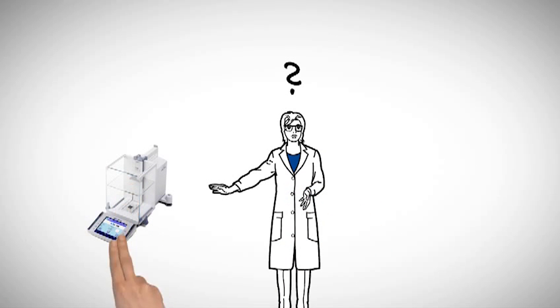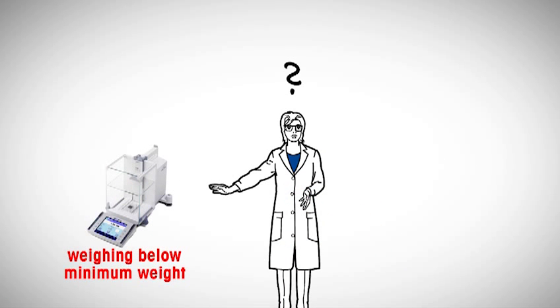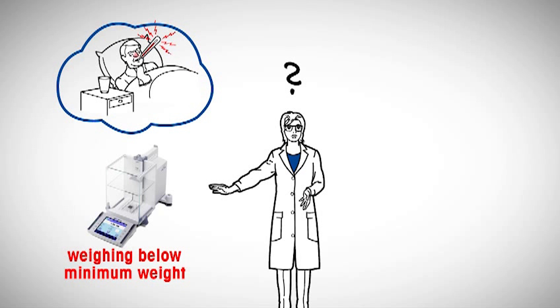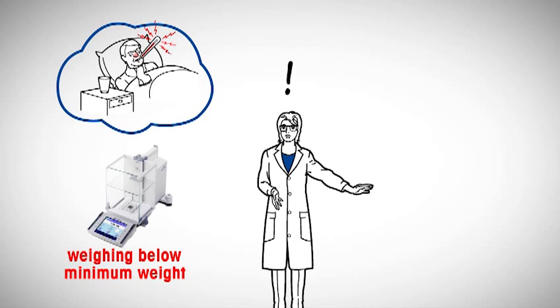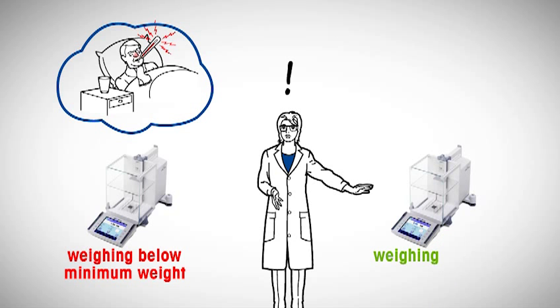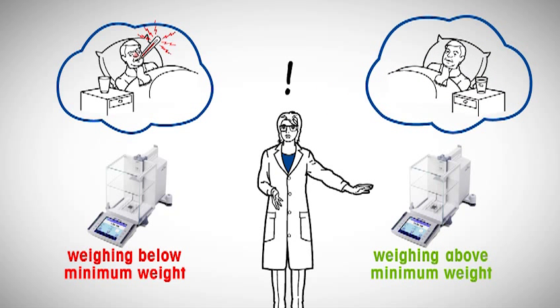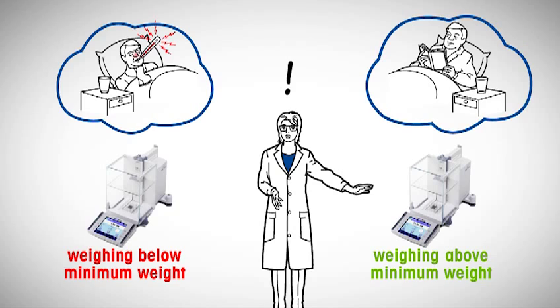Establishing the minimum weight of a balance is a simple and effective way to avoid weighing errors. You may think of the minimum weight as the accuracy limit of a balance. As long as you weigh above this limit, measurements are sufficiently accurate.